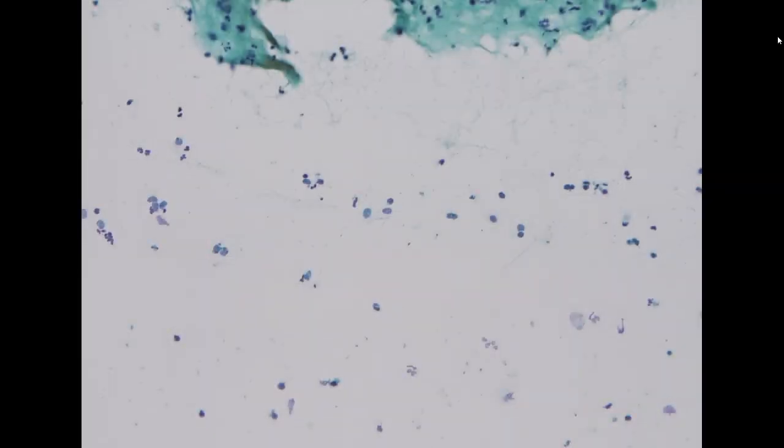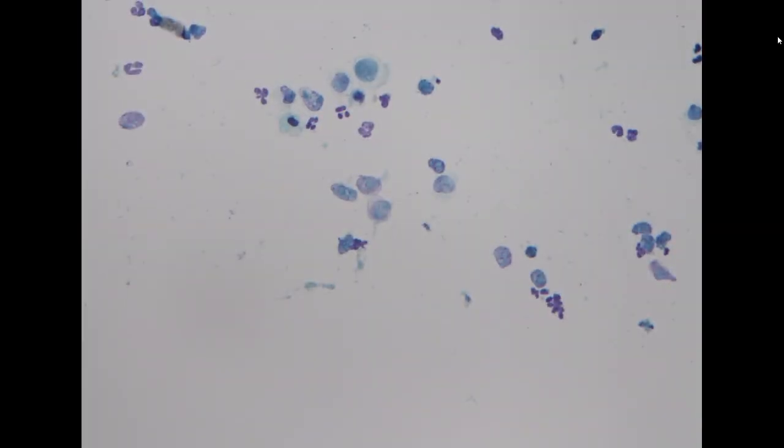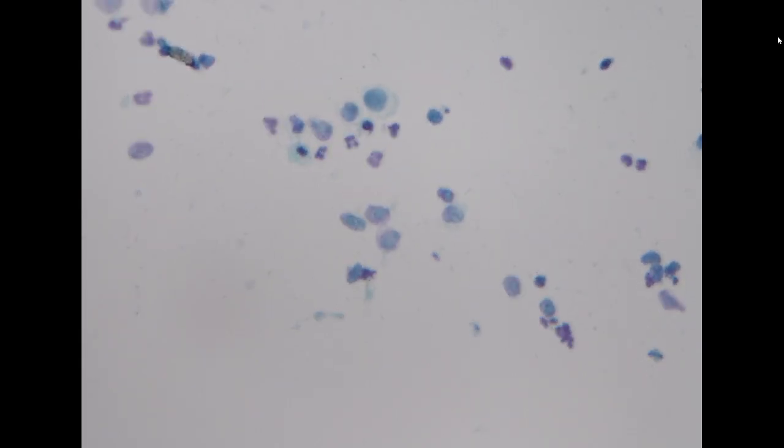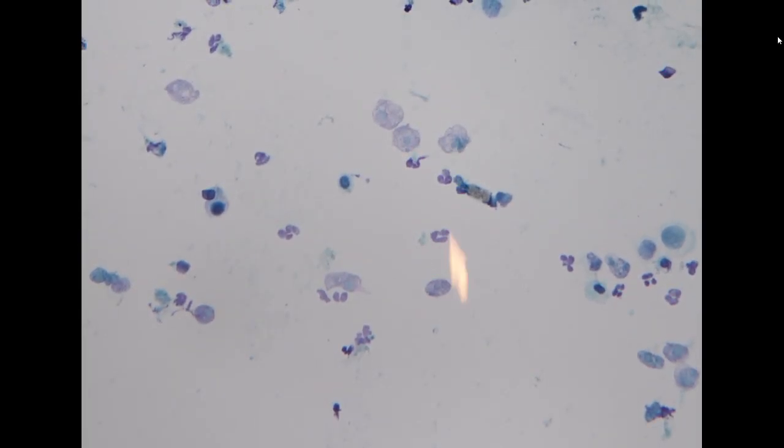The next specimen is a pleural effusion. The patient had a history of diffuse large B-cell lymphoma. The specimen shows a little bit of drying artifact, but even though the cells show marked dry effect, you can appreciate there are some large nucleoli in these very large looking cells. The nuclear contour is not rounded, it's angulated. So it doesn't show normal cell appearance. This cell looks malignant and is compatible with large B-cell lymphoma.